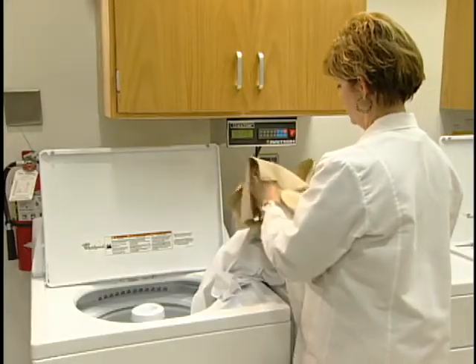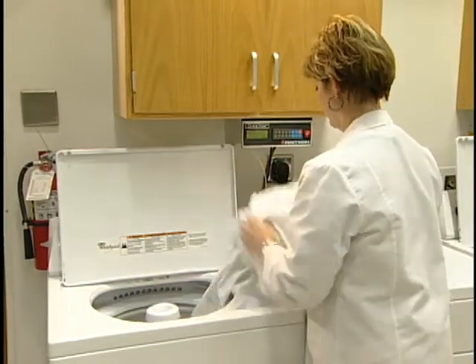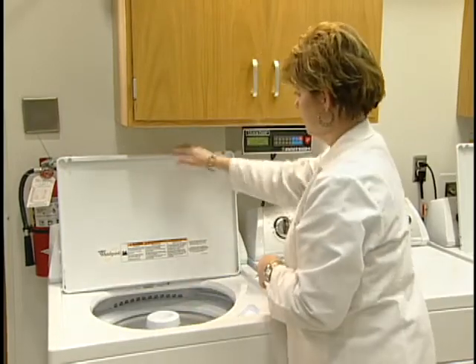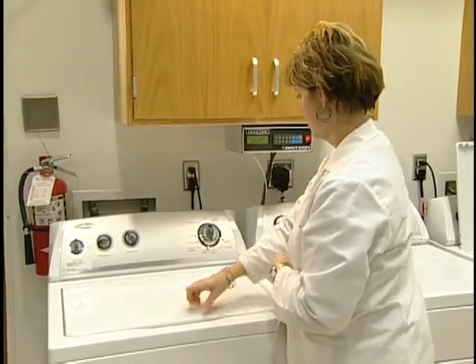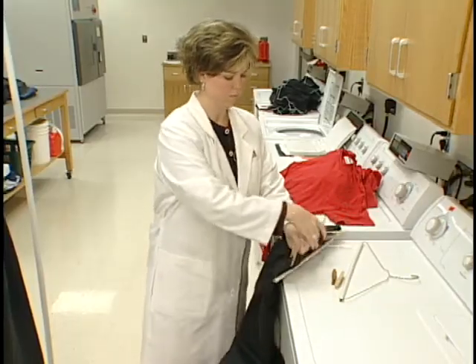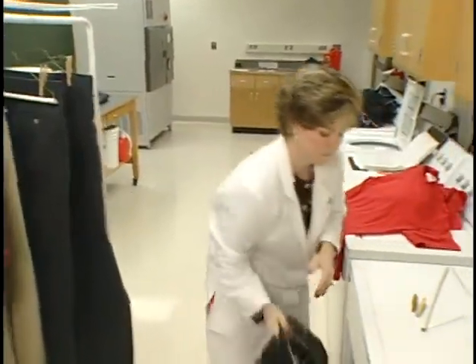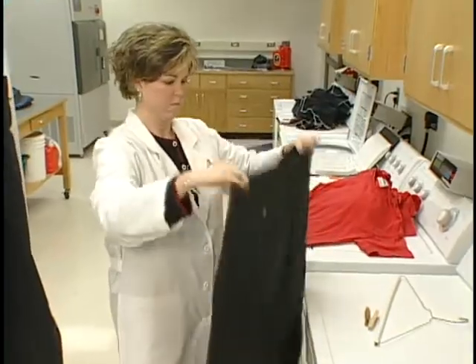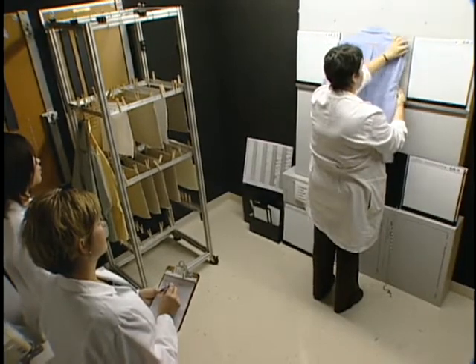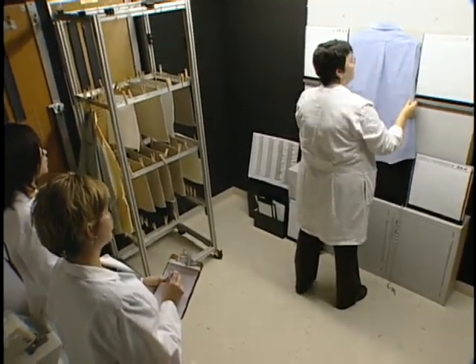The same laundering techniques discussed in the durable press segment of this section are pertinent to these evaluations. Choices are provided in the test method for hand or machine washing, alternative machine wash cycles and temperatures, and alternative drying procedures. After drying the final cycle and prior to the evaluation, the garments are carefully removed from the dryer and hung for conditioning as required by the standard. The smoothness appearance of a garment refers primarily to the smoothness of its fabric — the visual impression of a flat portion of the garment, usually the front, back, and sleeves.